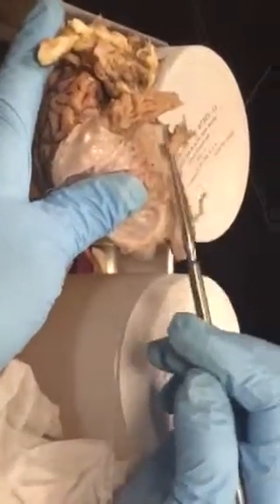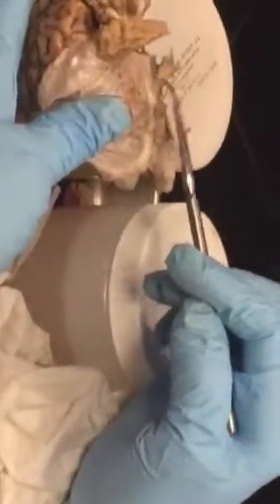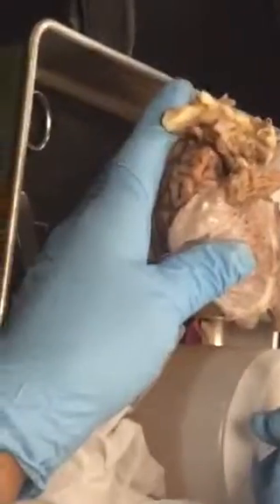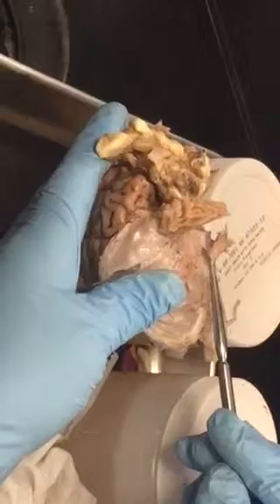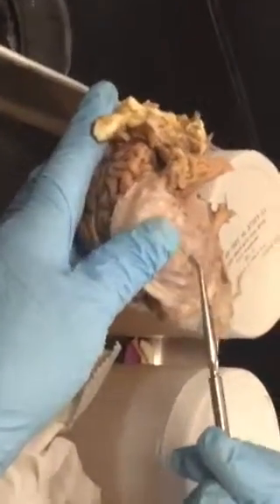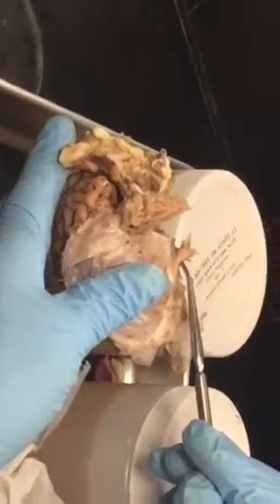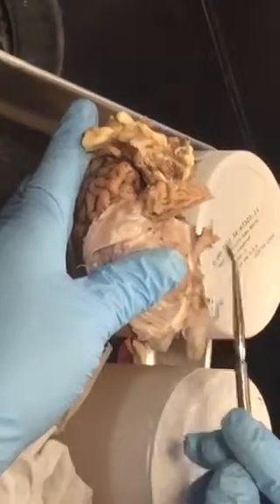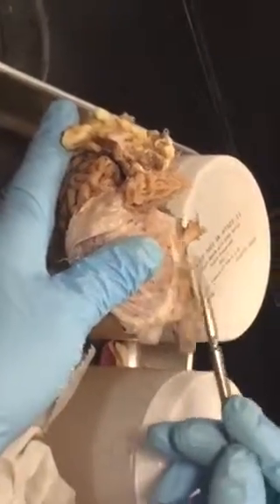What is this nerve if I point here? Name the nerve, or name the structure. Trigeminal. But if I want to be tricky, I can say name the membrane pierced by the pin here. What is the membrane? You could say that, but by definition, it covers the brain, the dura mater. This is already a nerve. What do you call it? A nerve. It's covered by connective tissue, but what do you call it? Epineurium. Epineurium.